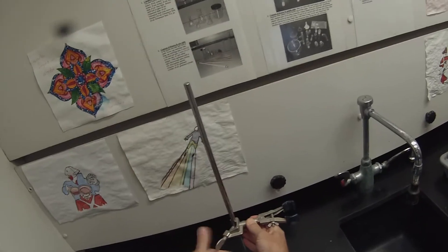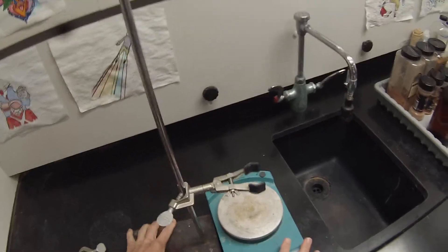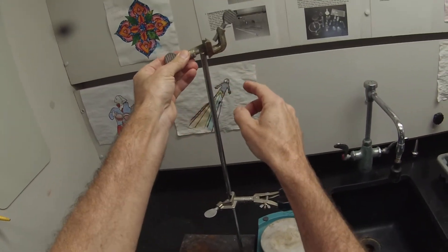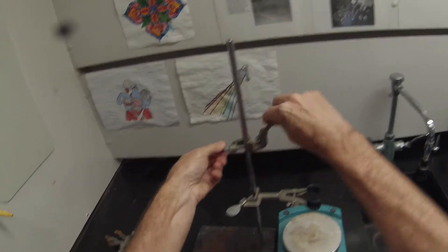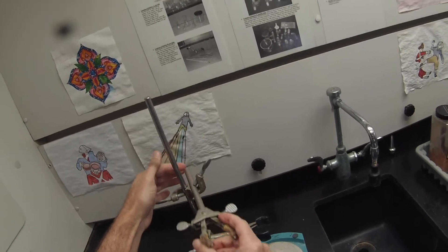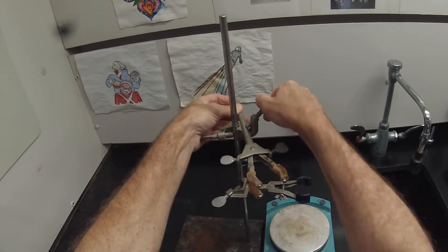So I'm going to be using this clamp to clamp my flask. And then this clamp here has a V-shaped piece. The V-shaped piece is designed to go on the upright of the ring stand, and then the adjustable clamp will sit kind of on top of this little shelf where it can move back and forth, and I'll be able to adjust that to the right length when I need it.